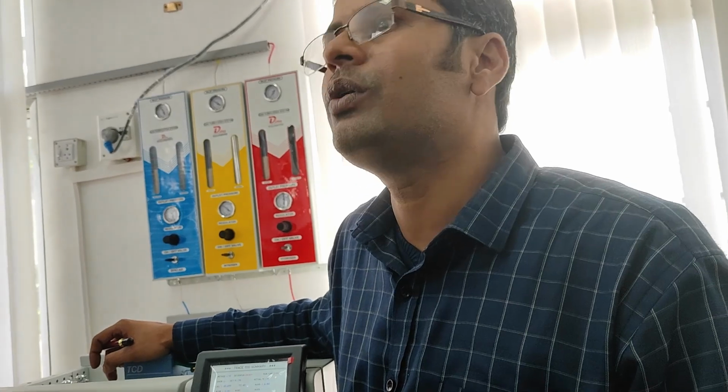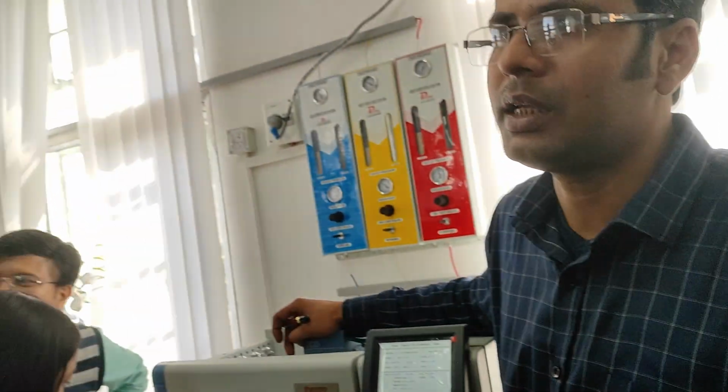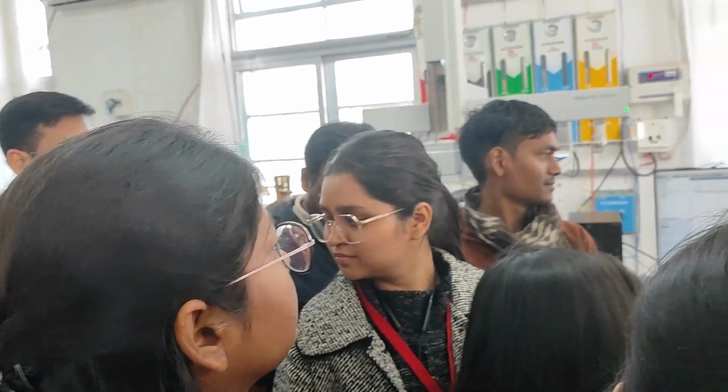You have to decide whether this gas can be detected in ppm and percentage. Now you have to decide because I don't know your study materials, but I know normally in this type of lab people do biogases and ECD. You can do some pesticides.